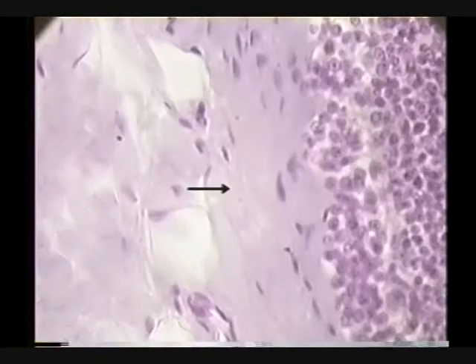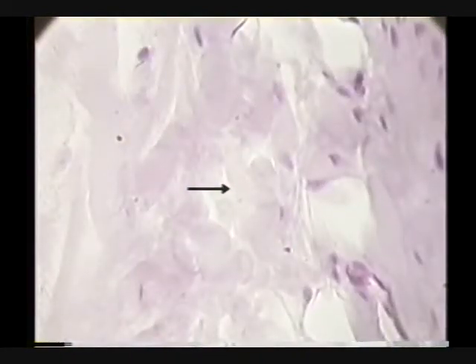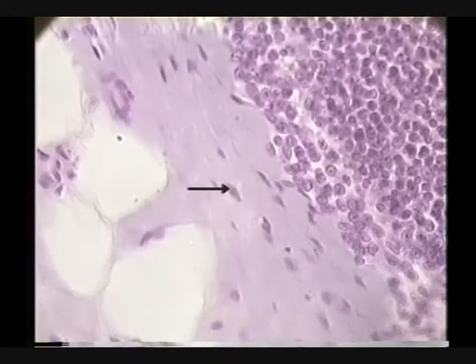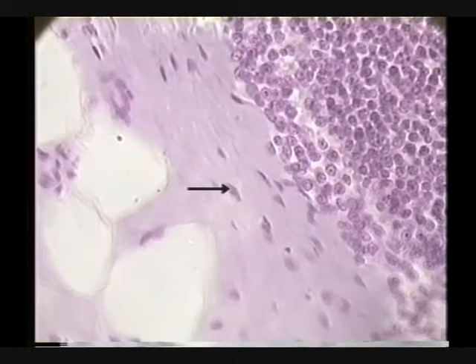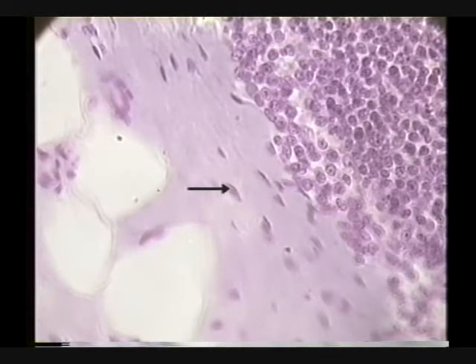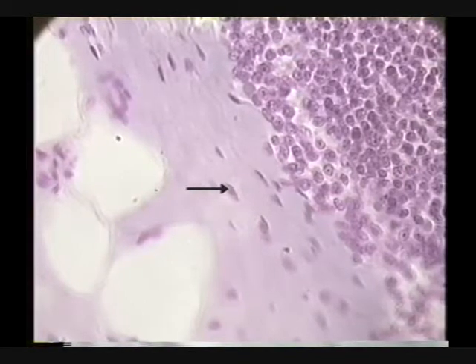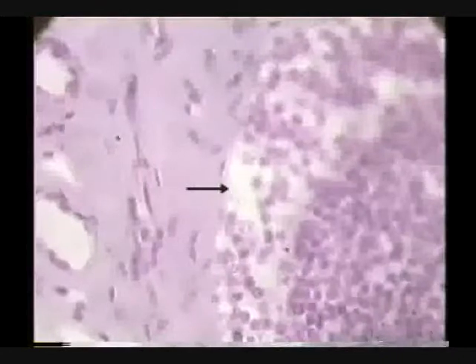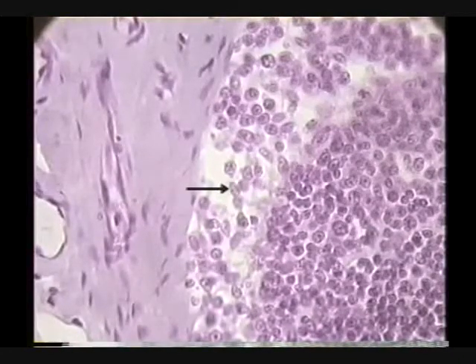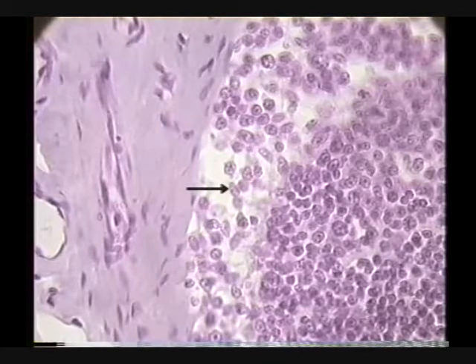What is this stuff out here? It looks like connective tissue - yes, white fibers, connective tissue. This is the capsule of this lymph node. We get under the capsule and you can see how the cells are sparser under the capsule because there's a subcapsular space.